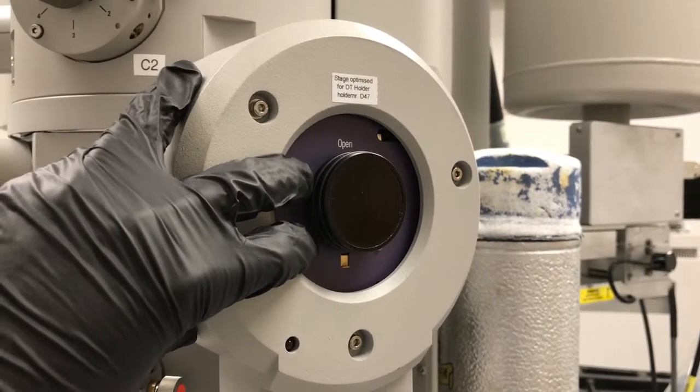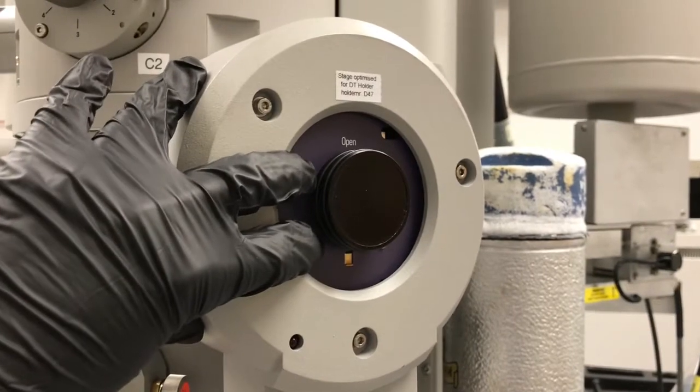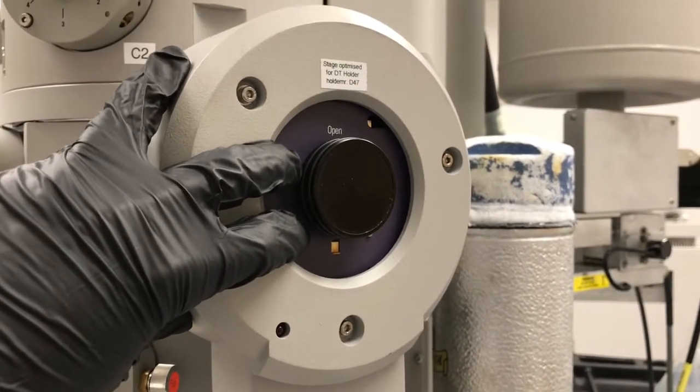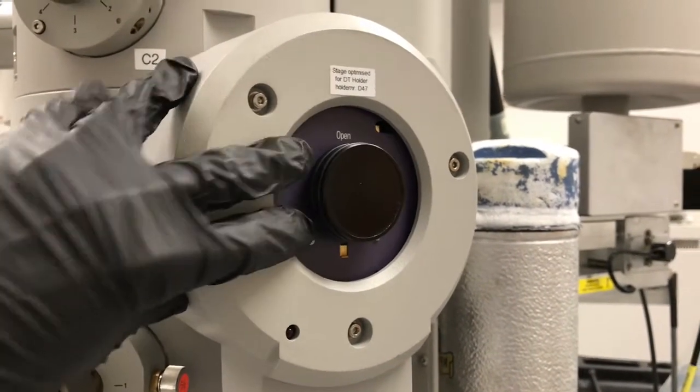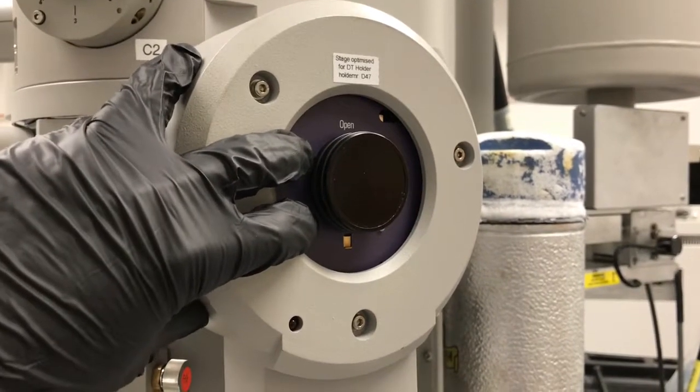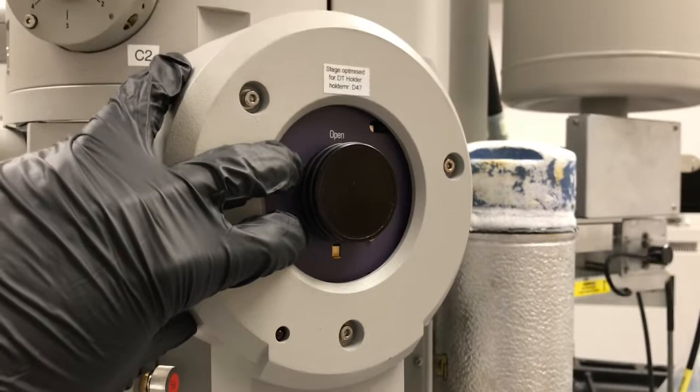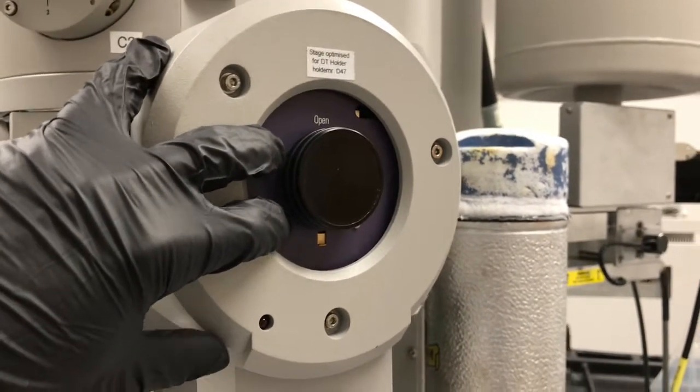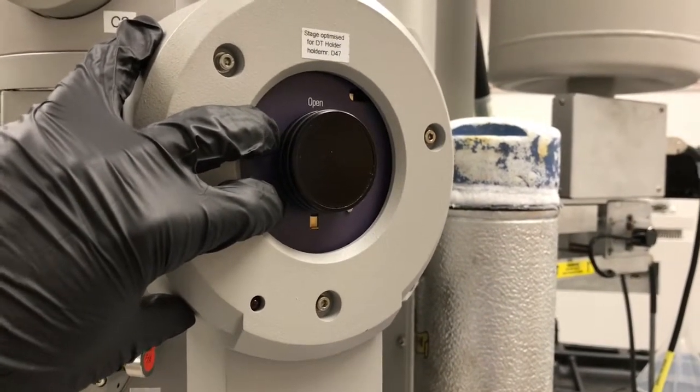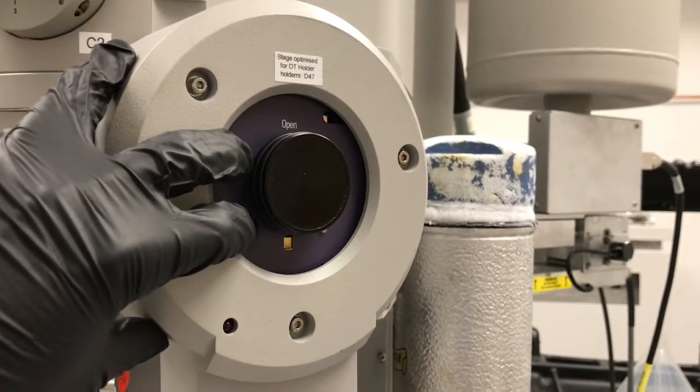You have to make sure even though your right hand is doing the pulling and the turning, that you're actively pushing against this purple plate with, in my case, two fingers here with your opposite hand or your left hand for most people. If you don't do that, you can potentially cause a crash. I actually ran into this just the other day with somebody that I was going over this with.